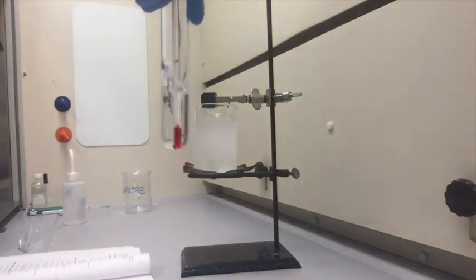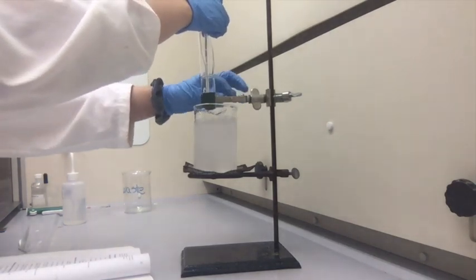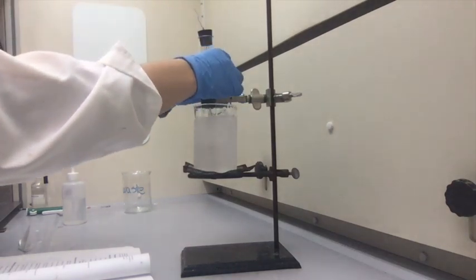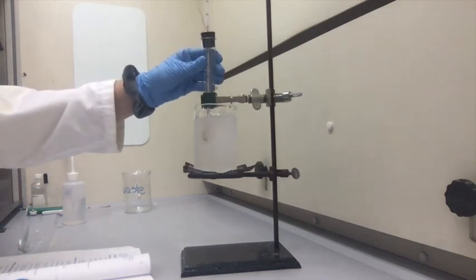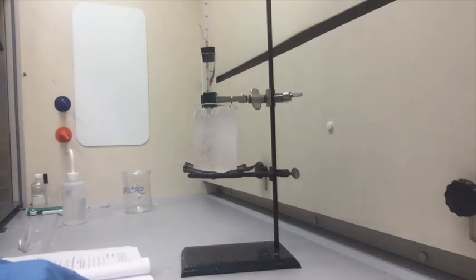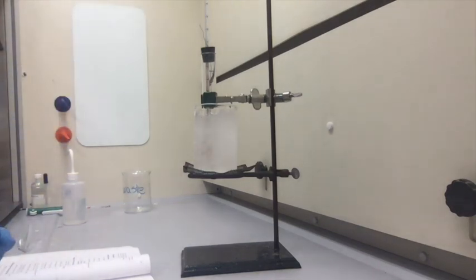Okay, now that it has all dissolved, I'm going to place it in the ice bath. I'm going to cool the solution to about 14 to 15 degrees Celsius and then record the temperature at 15-second intervals. So I've already got 14.5 degrees.